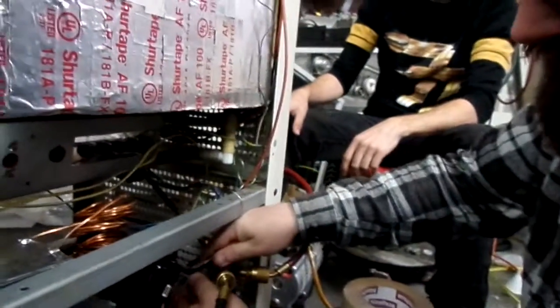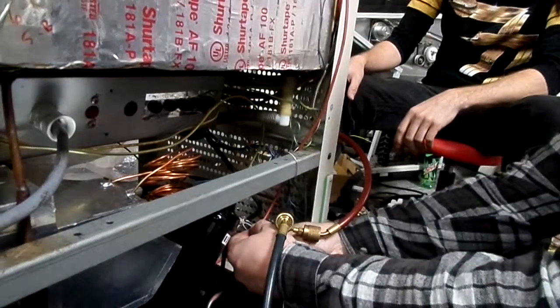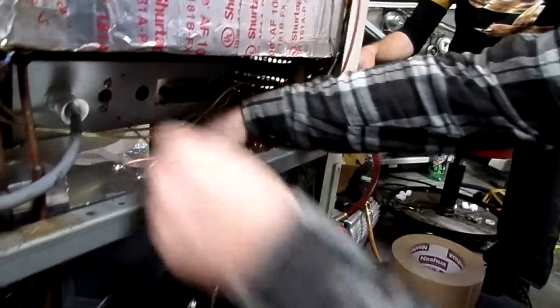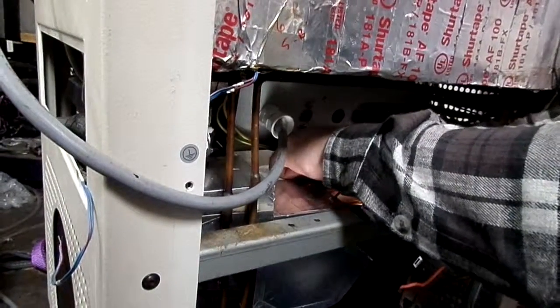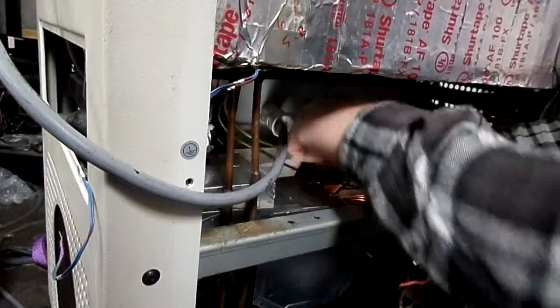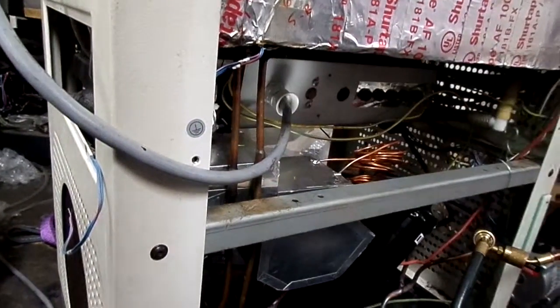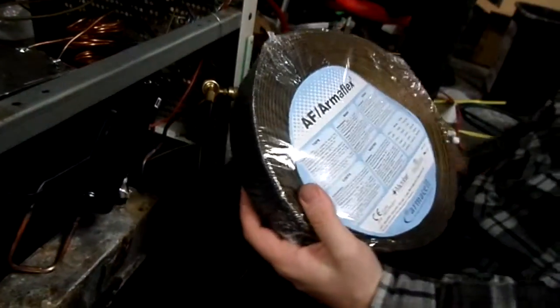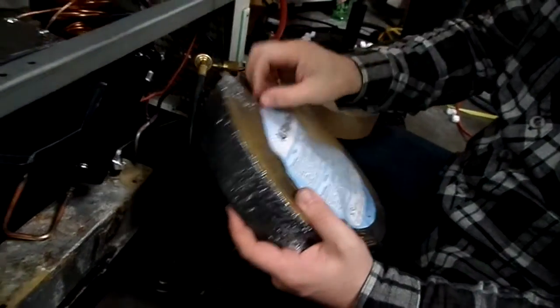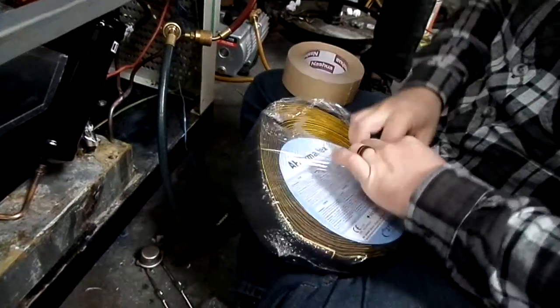Snip, snip, and snip. And then once you have your bulbs and your sensors in place, you just wrap it up with the foam tape, or insulation tape, that is provided in the E-valve assembly kit. This is the good stuff. This is the German stuff. You can't get this stuff in the US apparently. And it's disappointing because it's really good.